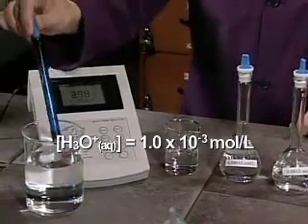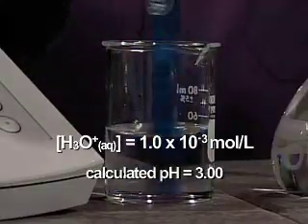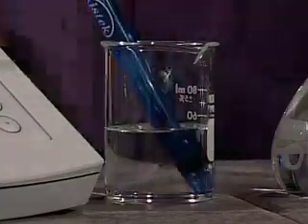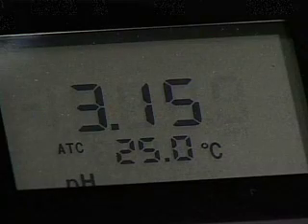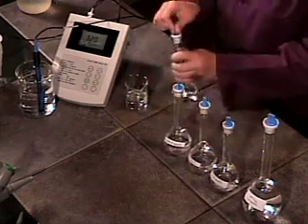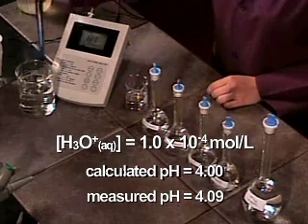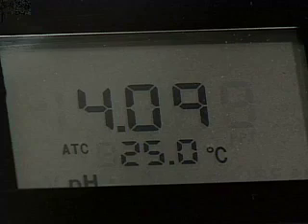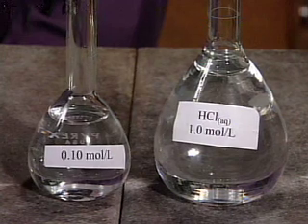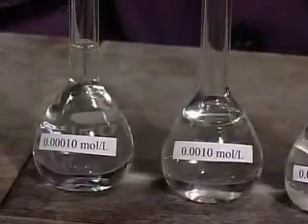The concentration of hydronium ions after the third dilution is 0.0010 mole per liter, and the measured pH is 3.15. The concentration after the fourth dilution is 0.00010 mole per liter, and the measured pH is 4.09. These solutions can now be used in biological tests.